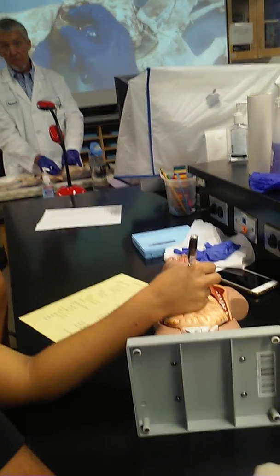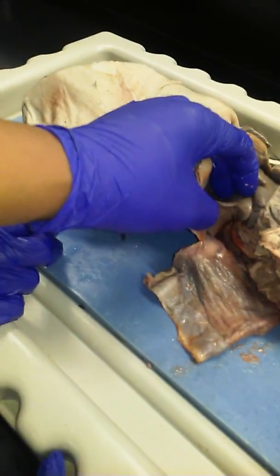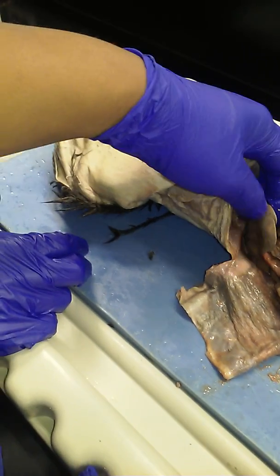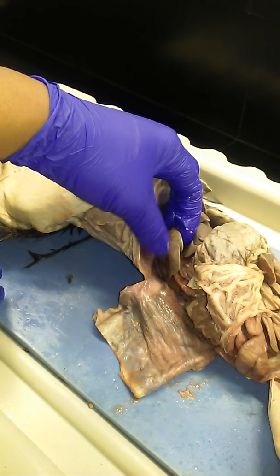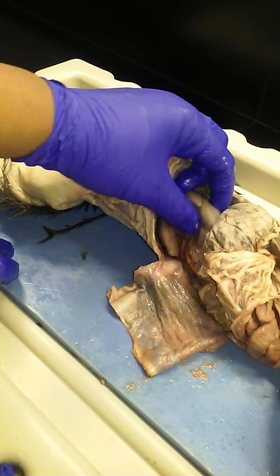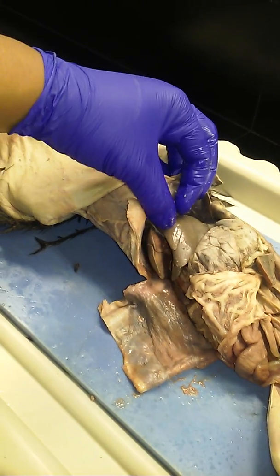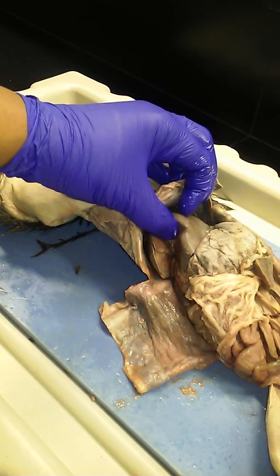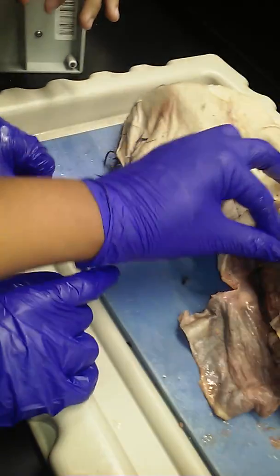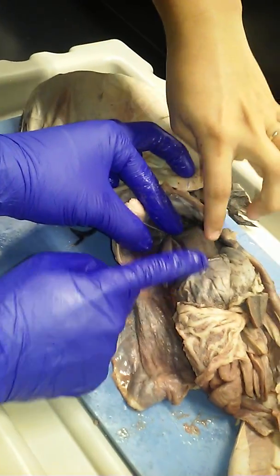Make sense? Common sense, right? So, right medial, right lateral, left medial, left lateral. 4 lobes. The little one's medial, right? The little one is medial, so the other is lateral. And then left lateral, left medial. Like that, right? Right lateral, right medial, left medial, left lateral.